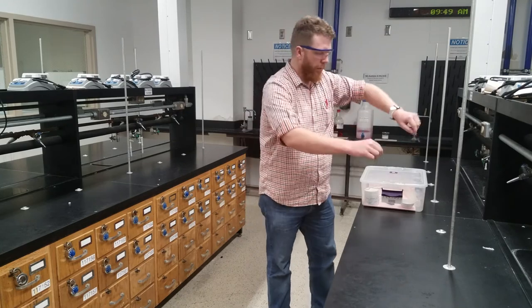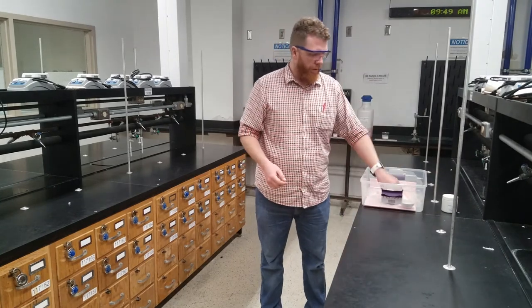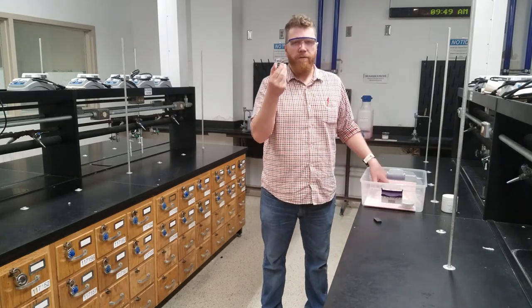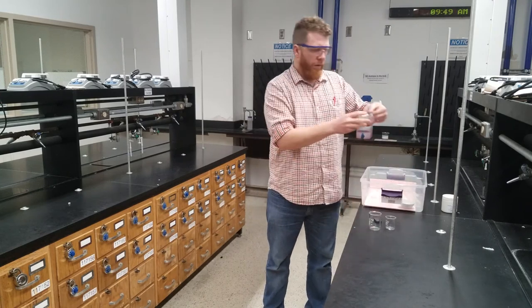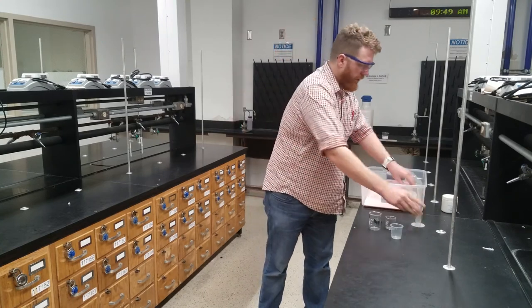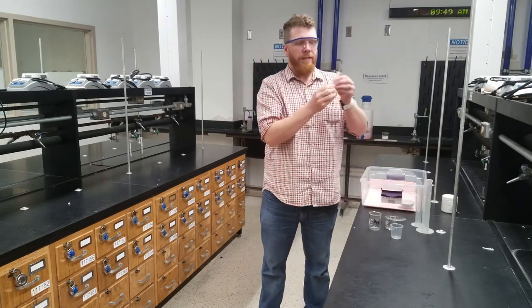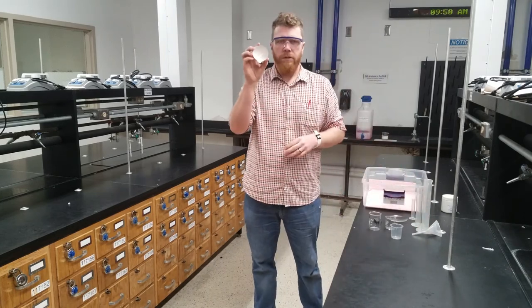Dr. Gray here. I want to talk to you about next week's lab. First, let's talk about the contents of your bin. You're going to find a magnet, a 50 mL glass beaker, a 100 mL glass beaker, a 50 mL plastic beaker, a 50 mL graduated cylinder, a 100 mL graduated cylinder, a watch glass, a 10 mL graduated cylinder, a funnel, and a ceramic evaporating dish. This is everything you're going to need for next week's lab.